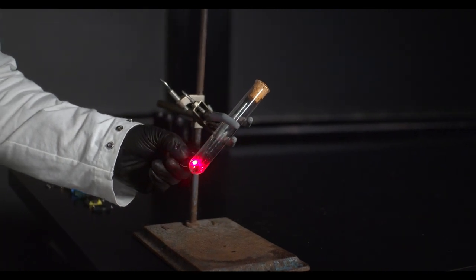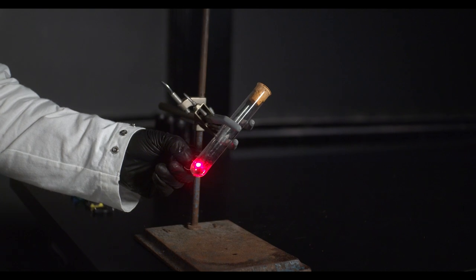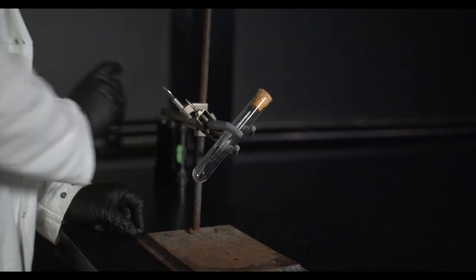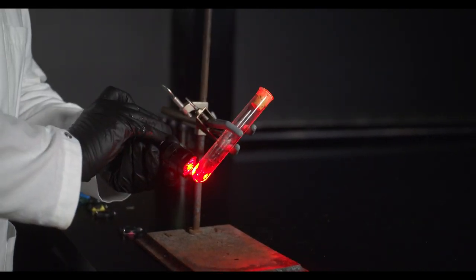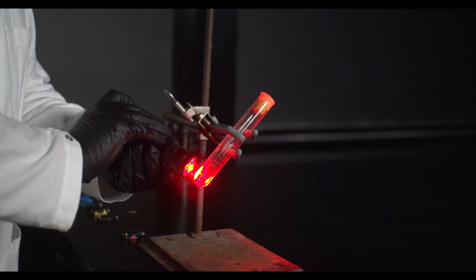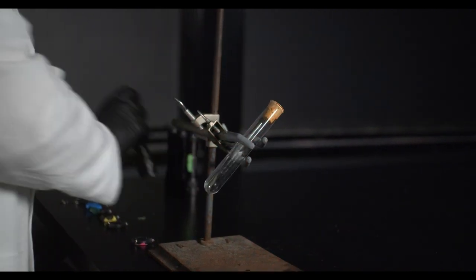So we're going to start with red light. Don't see a reaction. Maybe we don't have enough red light. Still no reaction.